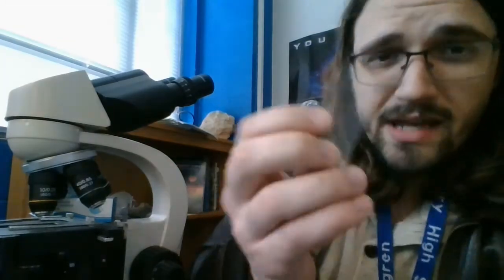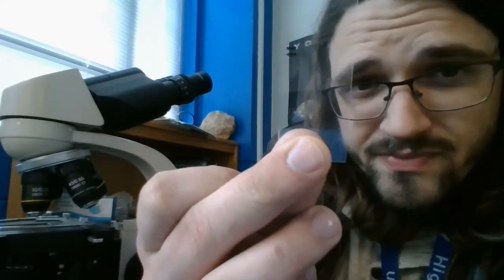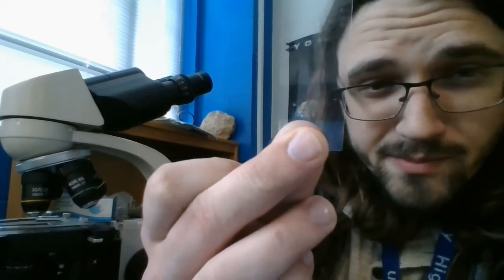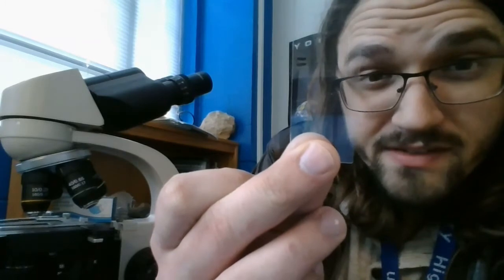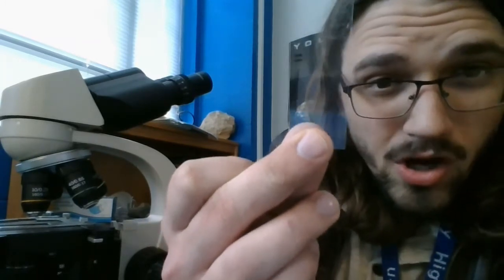And to do that, it's actually really simple. I'm sure there's fancier mathematical ways to do it, but the simplest way to visualize it is I have made on this slide a couple of tiny little marks. These marks are a millimeter wide, and they're spaced a millimeter apart, and they're exactly 3 millimeters long.